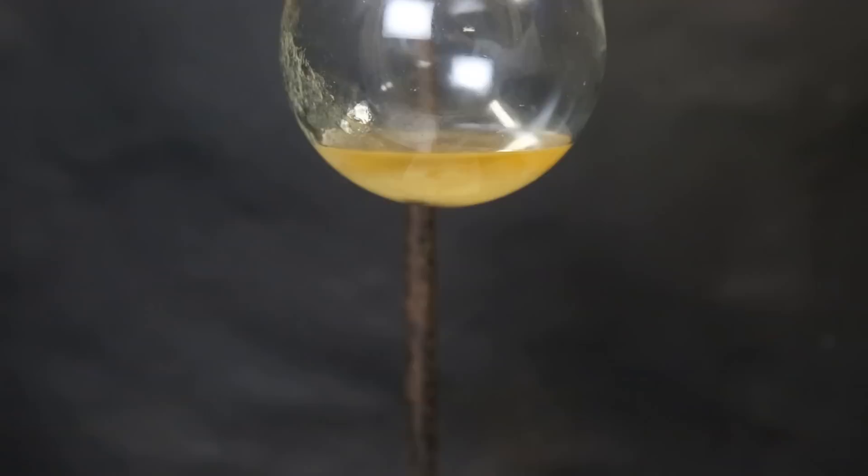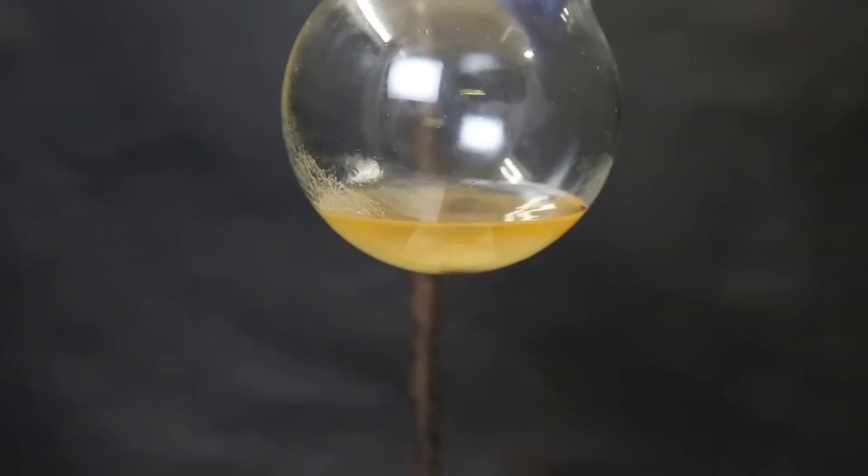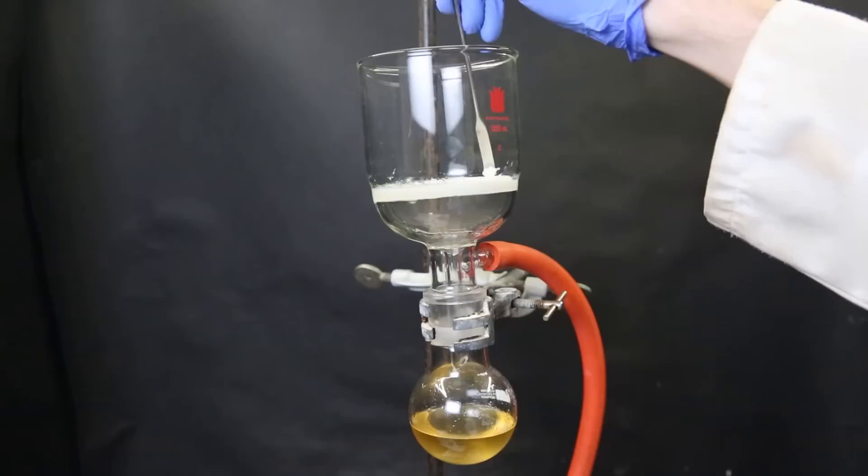And they also travel a good distance up the plate, so I will use this as my eluent for the column. After letting the phenyl B-epin sit for a day, some crystals had settled out. Since the phenyl B-epin is a liquid, this must be one of the reactants or an impurity. So it is actually fine that this happened, since I can remove it easily. I set it in the freezer for a bit, so everything will settle out. And then I filter it all with vacuum filtration through a glass-fritted filter.